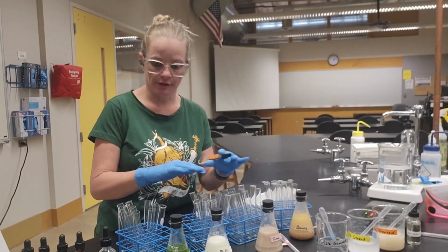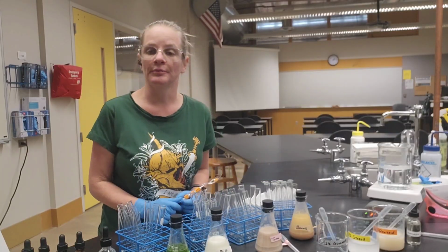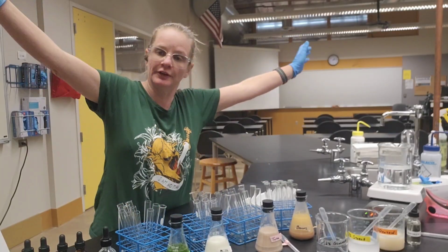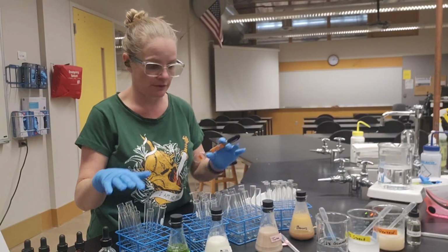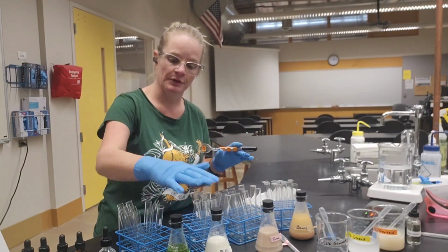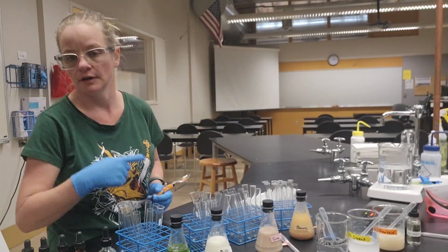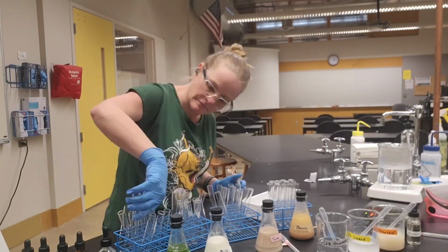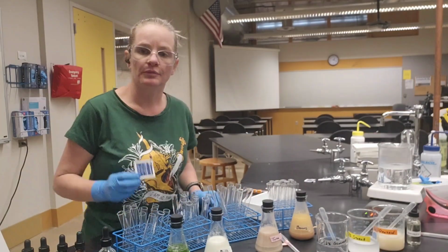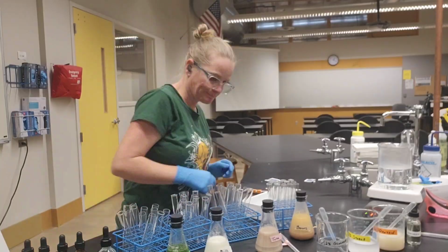Now that I've got all the lines drawn along the bottoms of these test tubes, I can do the most important part of science, which is labeling things. So I have 4 foods that I'm going to test. So the first thing that I'm going to do is label all of the tubes with a particular food that is correct for them. All right, another time lapse for you, lucky you. Pro tip, if you ever need a Sharpie eraser, alcohol swabs.